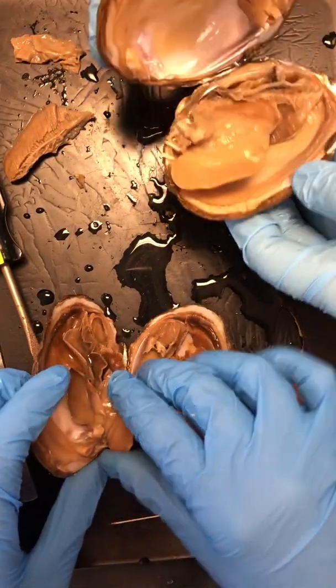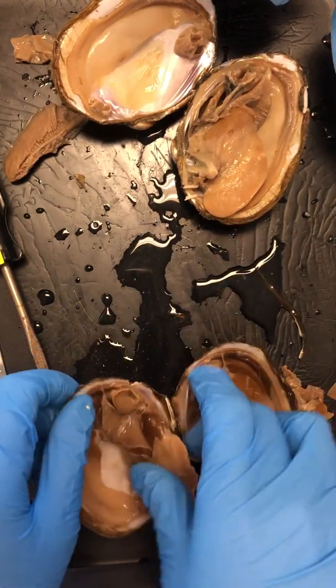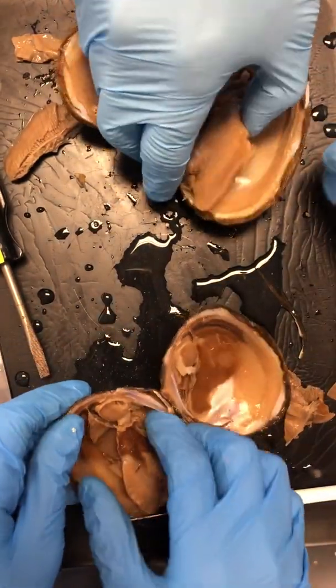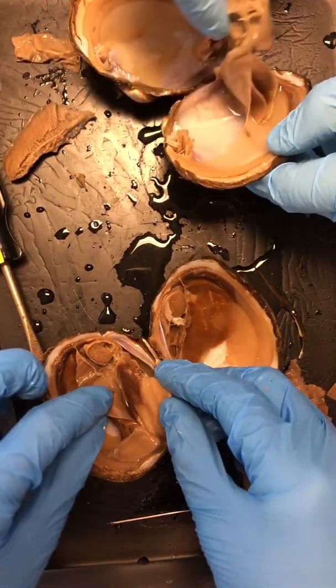When we come back, you guys will rip them apart yourself in a respectful, dignified way. Oh, nice. This actually looks pretty good. But for right now, I just want you to have some kind of idea of what's inside one of these guys if you ever happen to run across one in the wild.